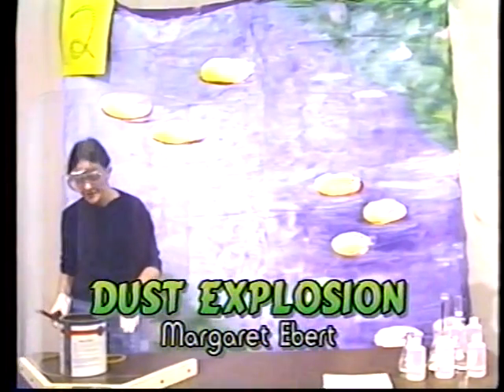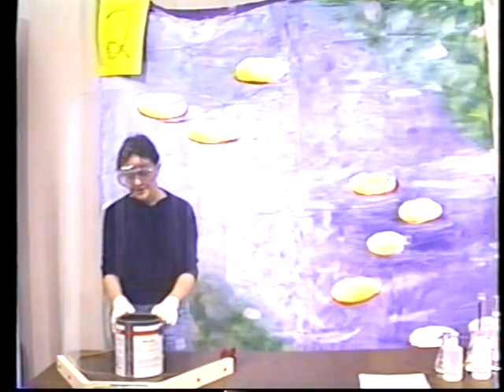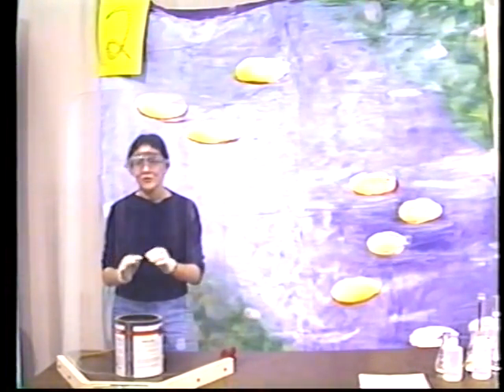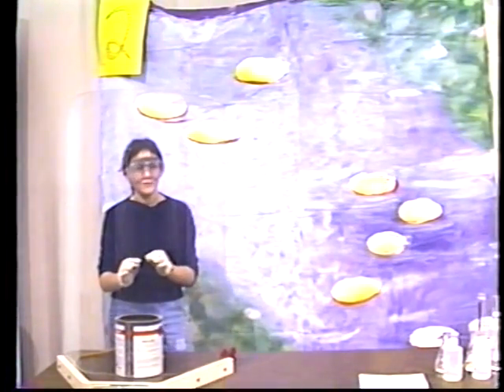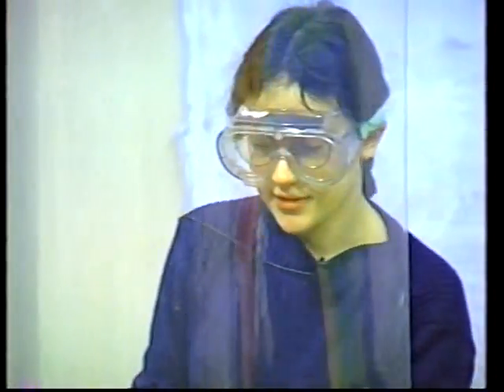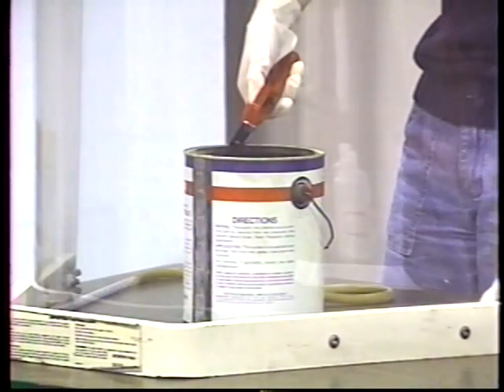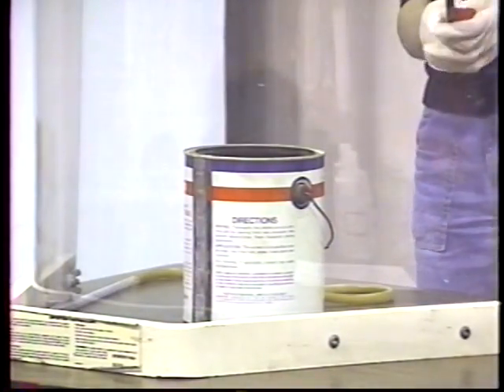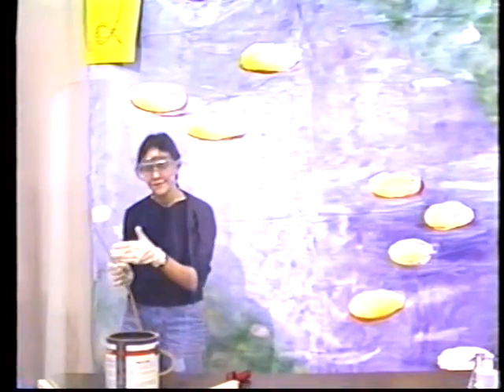Okay, my demo is called the dust explosion, or grain elevator explosion. This paint can represents an elevator full of fine powdery grain, and inside it I've put lycopodium powder, which is actually a fine powder made from the spores of a fungus, and it's explosive. Now I'm going to introduce a flame by lighting the candle inside. And now when I disperse the powder into the air and blow it into the flame, you'll see an explosion.